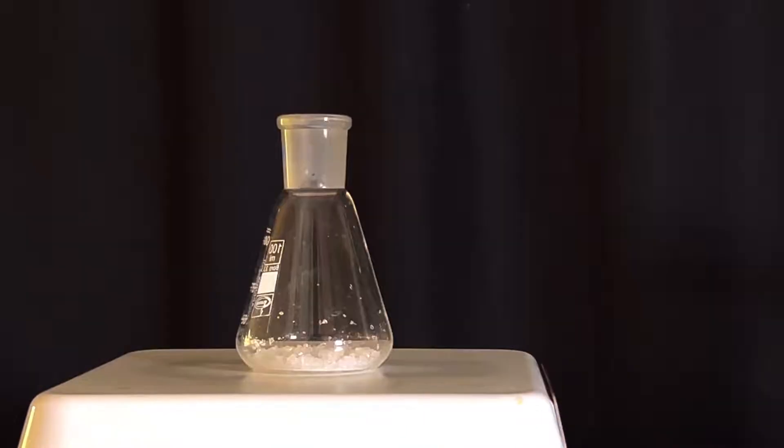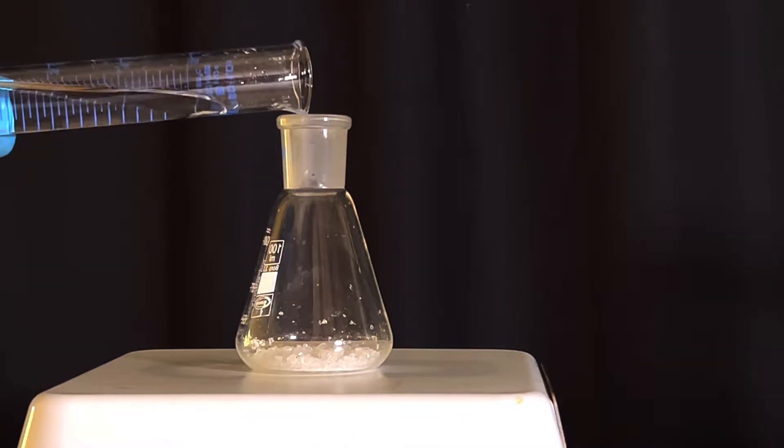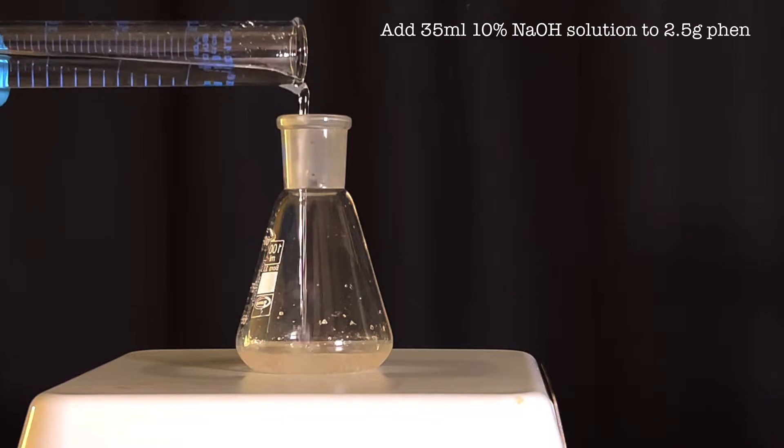Next, a 100 ml Erlenmeyer flask was taken and 2.5 grams of phenol crystals was taken in it.